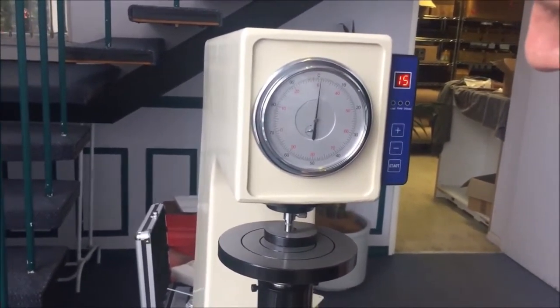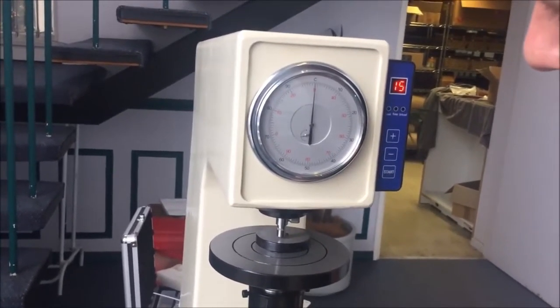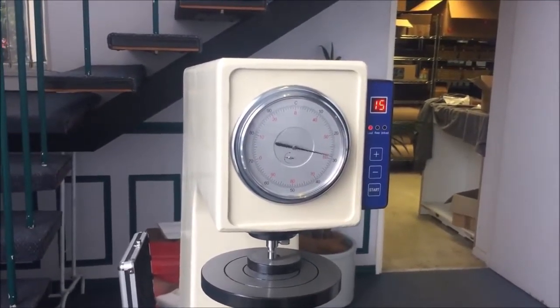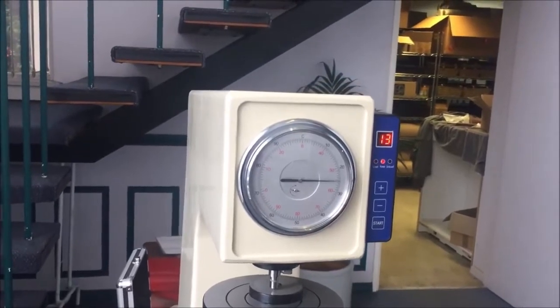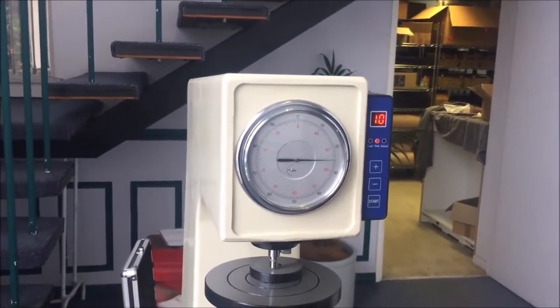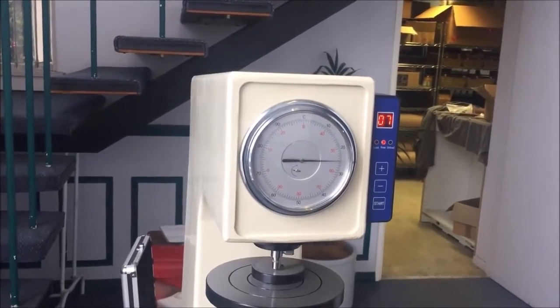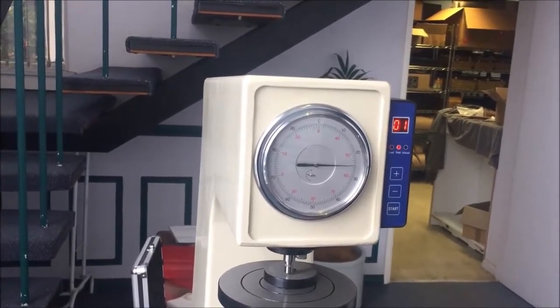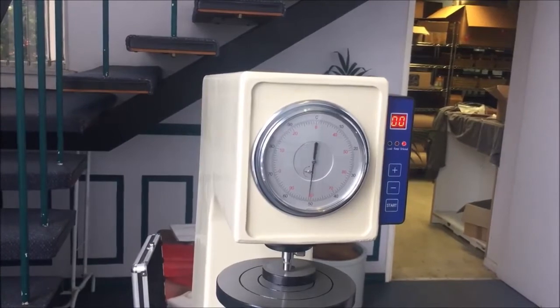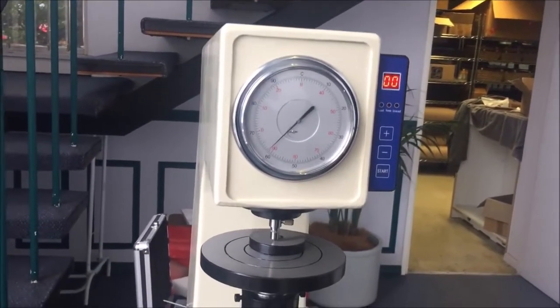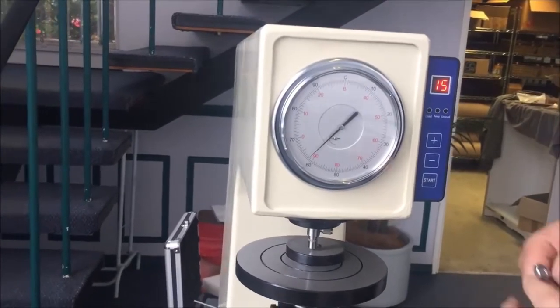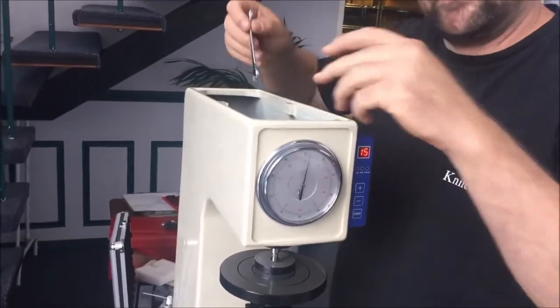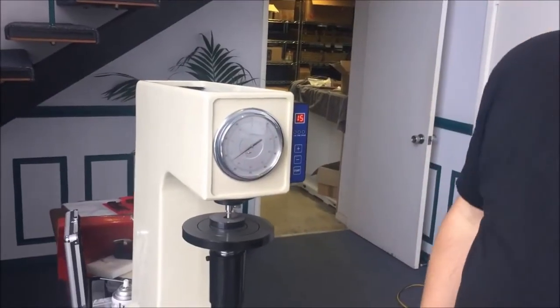We're getting 61 again, 61.2 somewhere around that. And I'm just going to take one more. And I'm pretty comfortable with it sitting at 61.5. I could play with it some more, but you get the idea and you're welcome to play with yours as much as you like. Contrary to what your mother told you. And here we go, 61.5 on the nose. So like I said, I wouldn't be mucking around with that. I think that's fine. Cool bananas, turn off.